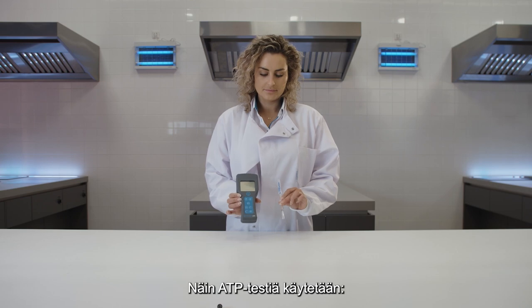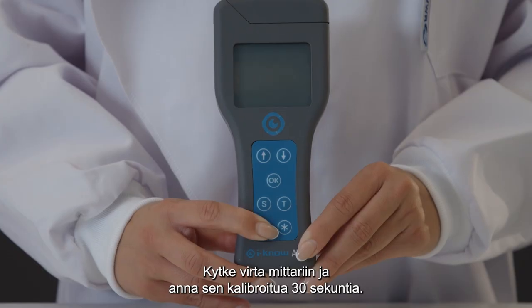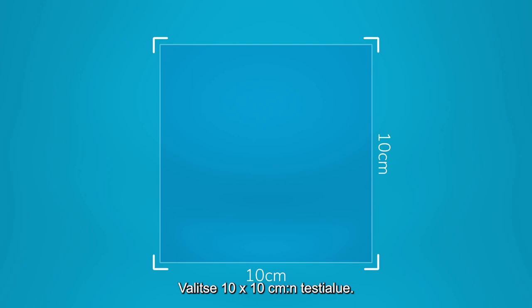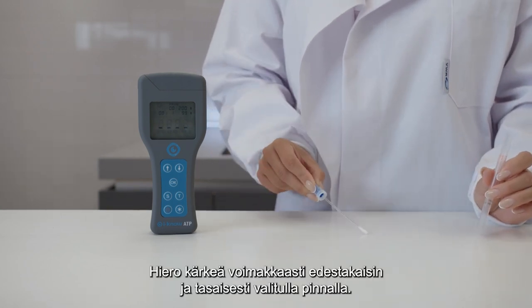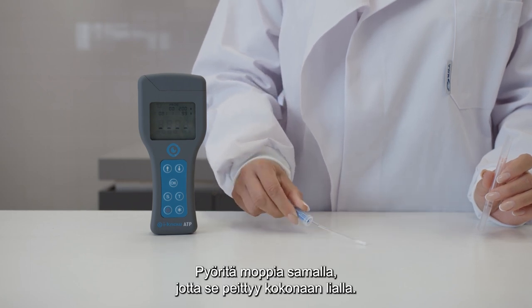This is how you use the ATP tester. Open the holder and check if it's empty. Turn on the meter and allow it to self-calibrate for 30 seconds. Select a surface of 10 by 10 cm as a test area. Pull the swab from the holder and make sure that nothing touches the tip. Rub the tip firmly back and forth over the selected surface equally, rotating it as you go so you cover the entire swab.